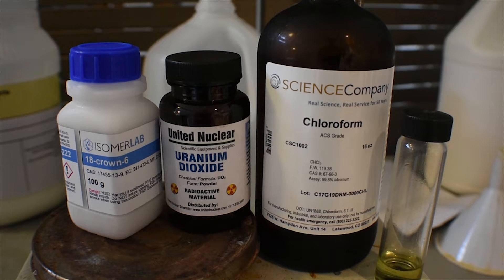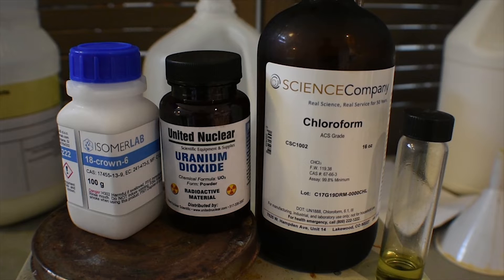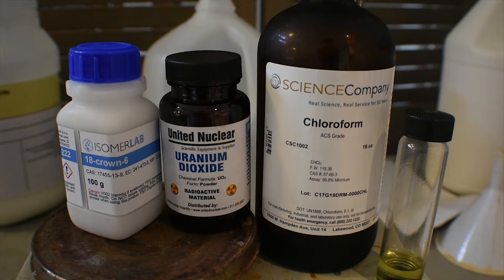Before I begin, I must point out that we will be in contact with radioactive materials and soluble uranium. Uranium is a heavy metal, and even though its radioactivity is pretty low in this state as a soluble compound, it's still a heavy metal like lead is, so treat it as such.